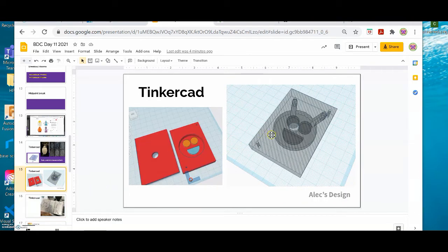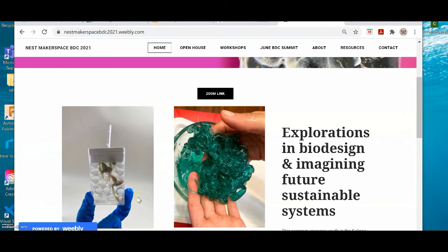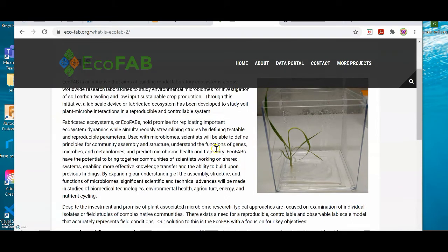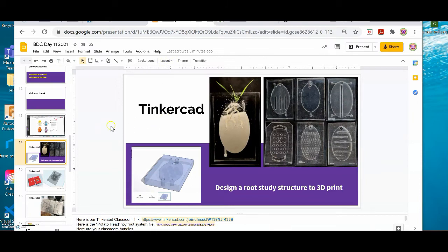Just backing up a little bit, this is created in Tinkercad. You're going to create a base layer and then a lid layer that you're going to slide on top. And this whole project is inspired by a research project at Berkeley, as well as our very first project, which was studying root growth in hydrogel beads that we stuck into Tic Tac containers. So this all revolves around the conversation of how might we study making little models of ecosystems, controllable ecosystems, to study soil and plant microbe interactions.